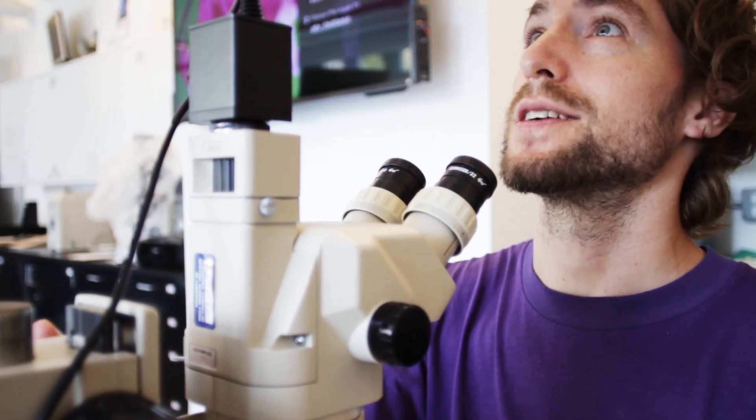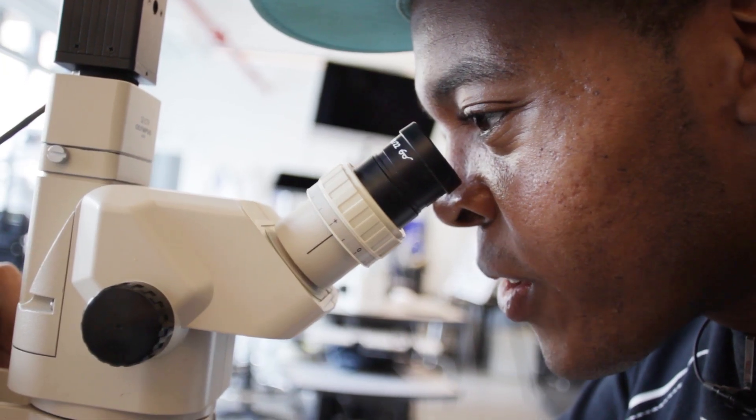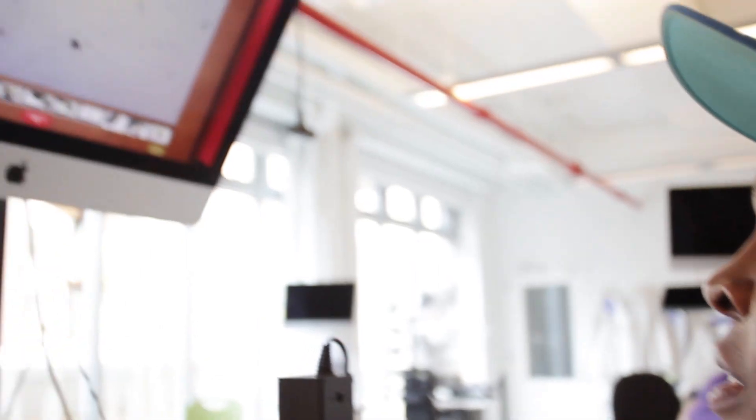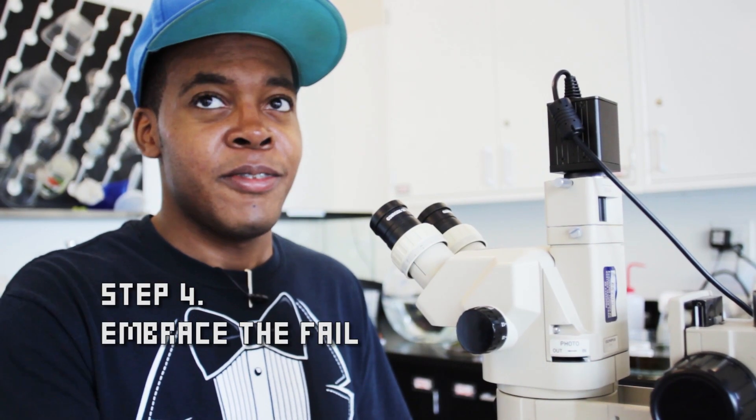But now Dr. Ben, what do you see? Do you see a water bear? Is that... that's a bear. Not a bear. It's a critter. It's a critter. So whatever that thing is, it's not the microorganism that we're looking for. We continue searching but we're not having any luck. So let's go to day two.